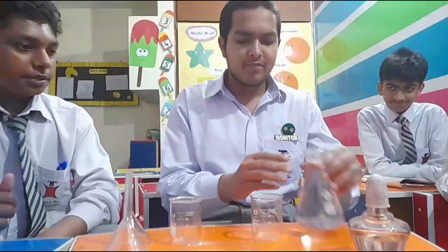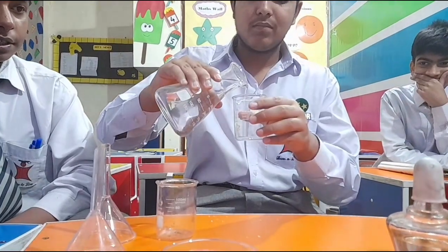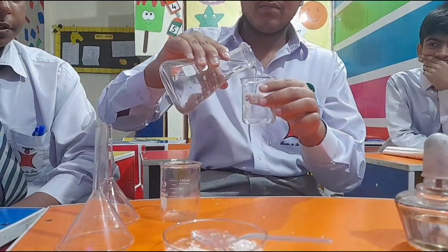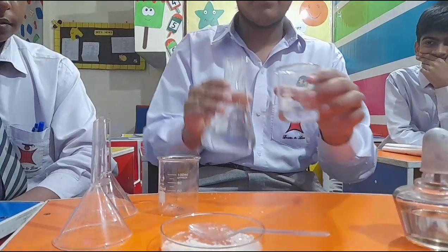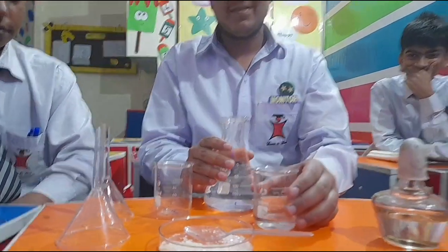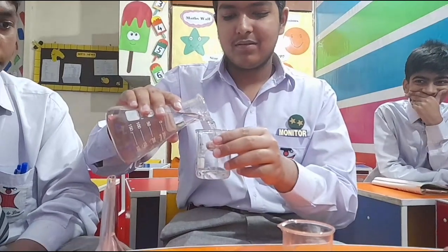First, we are going to take water and we are going to pour it till 20 ml in both the beakers. First beaker done, now doing the second beaker.